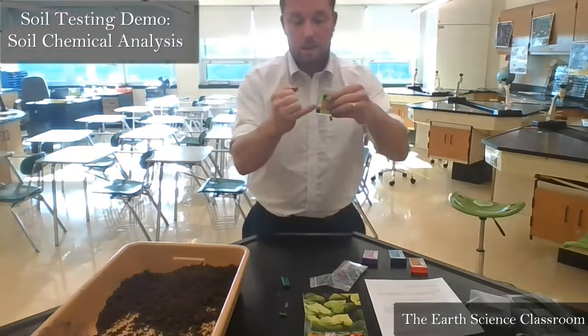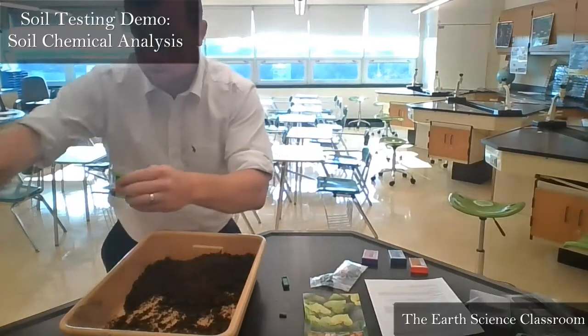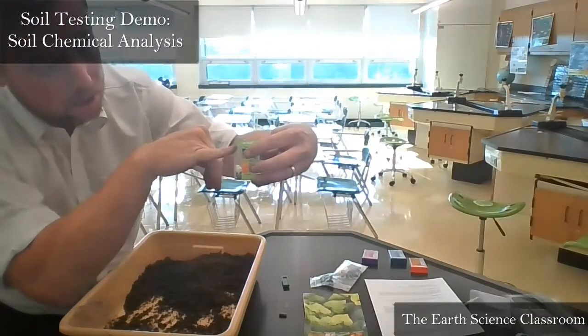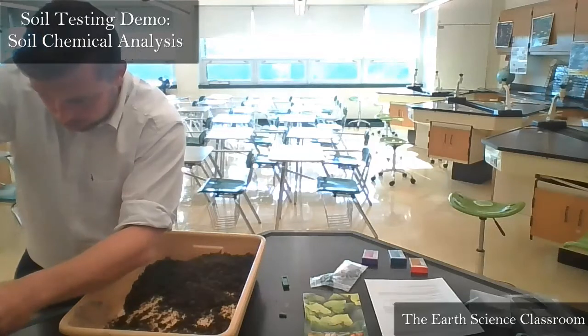Now, you have the soil and the chemical indicator. You add some water, but a very small amount of water, okay? You're going to fill water up to this little dashed line at the top here. That's the point where you add water. So it's a small amount of water, a little trickle of water.